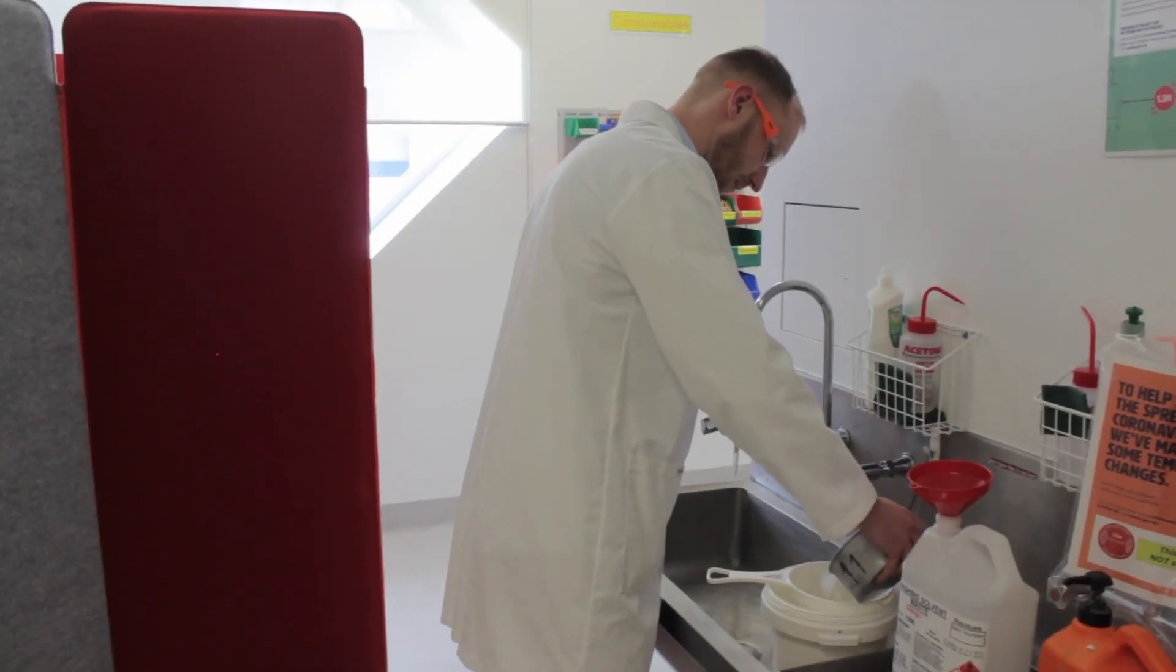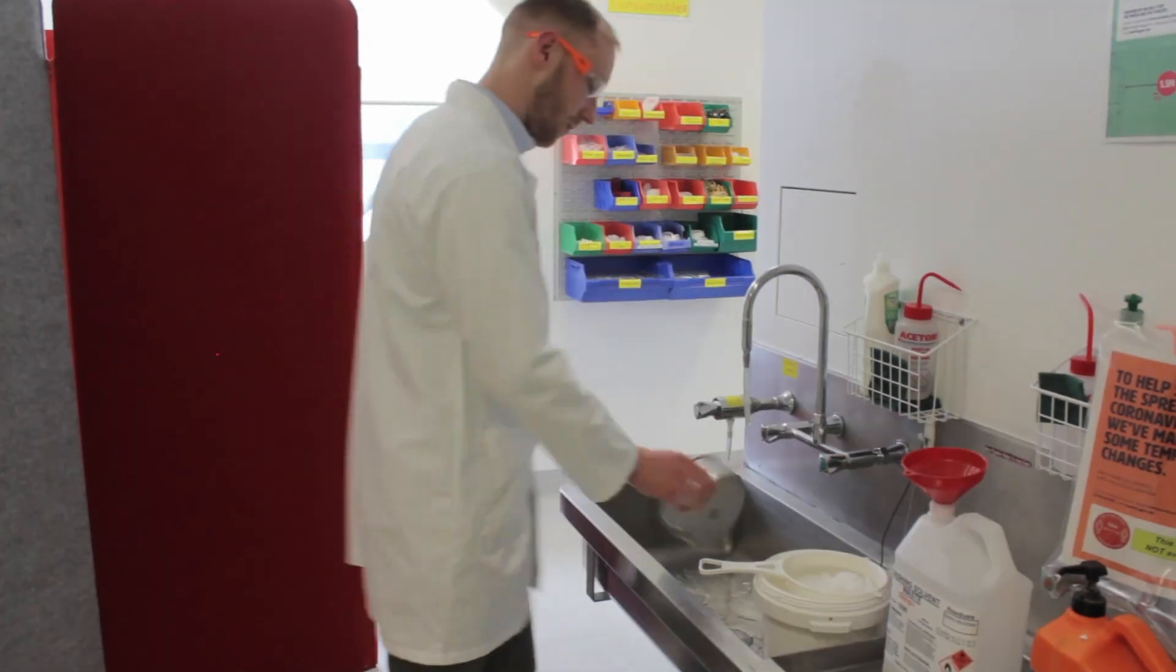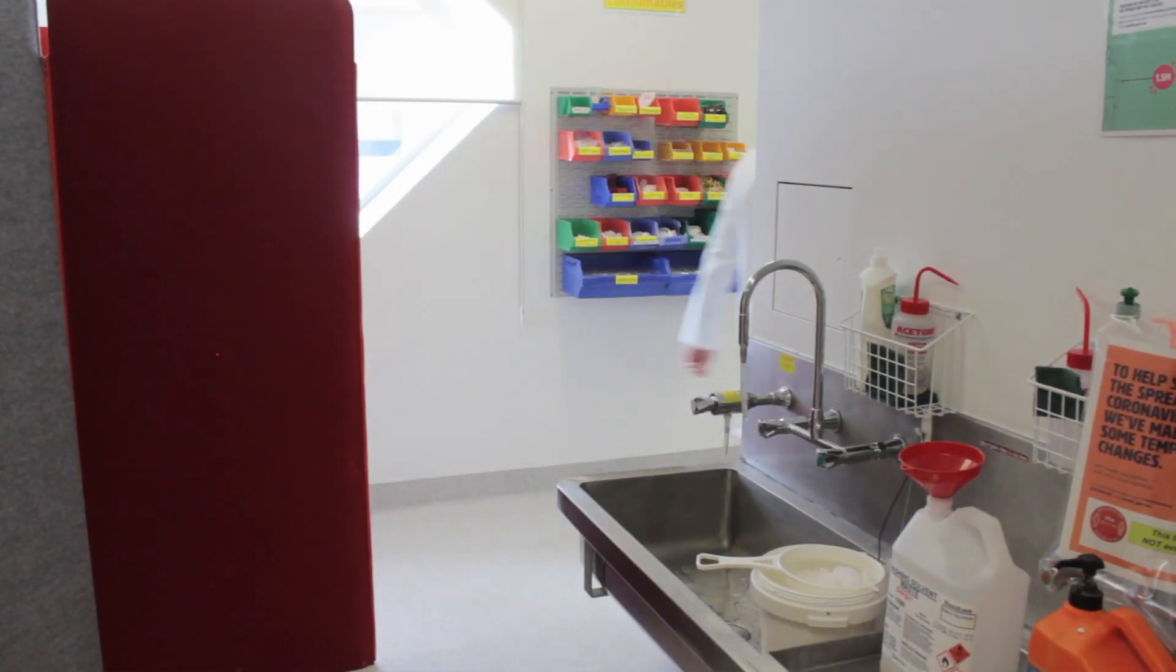Once you're done, pour your ice bath into the buckets in the sink. Make sure it's safe.